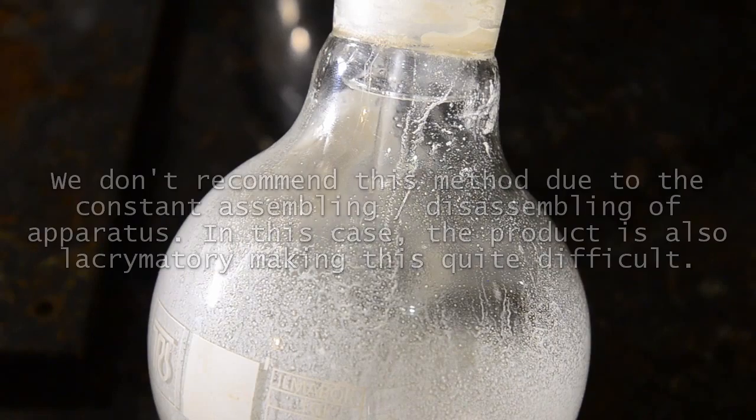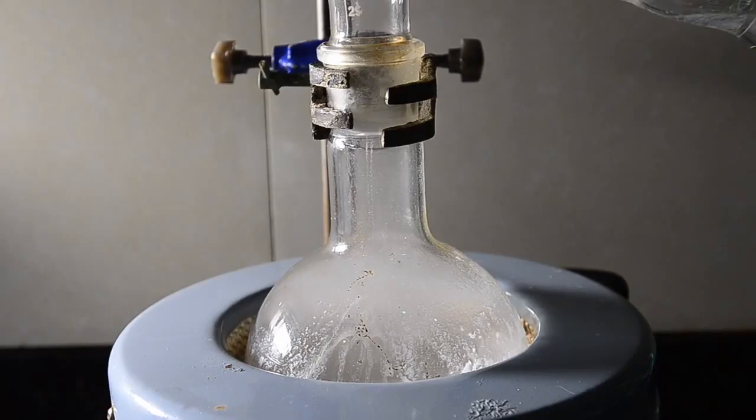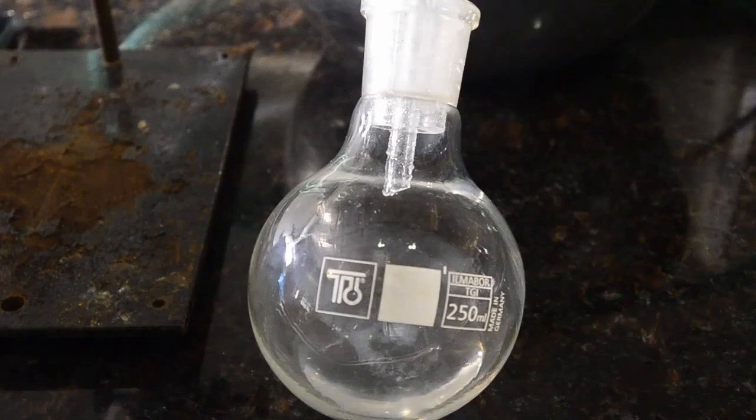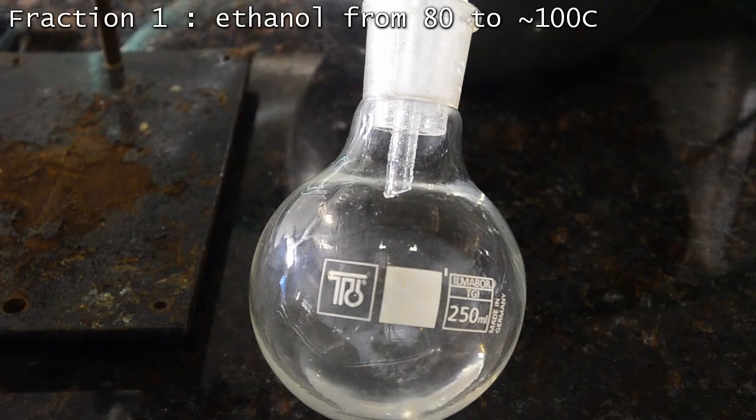After we continued this process for about 2 hours, we decided to switch back to simple distillation without the calcium oxide, and first distilled off excess ethanol from the reaction mixture. As the distillation temperature gradually rose above 100 degrees C, we changed flasks and collected another fraction.